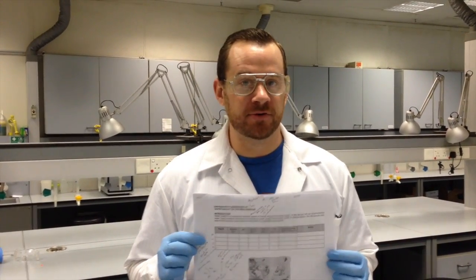In preparation for this lab, you should not only be looking at the lecture, you should be following this tutorial, and you should be looking through the protocol that will be posted later. I have my protocol with me, and I'm going to first take you through the initial spectrophotometry assay, which half of the class will be doing on ammonium.